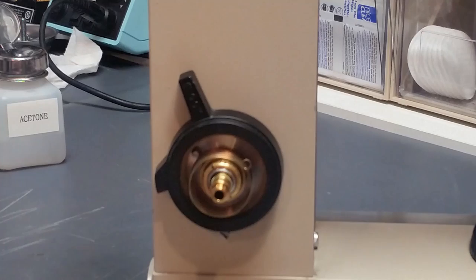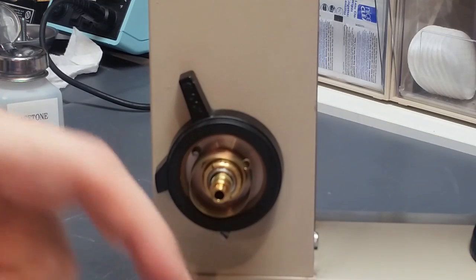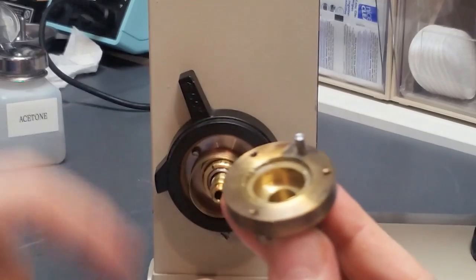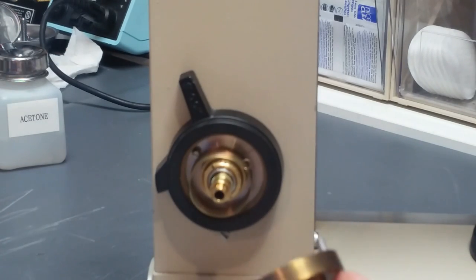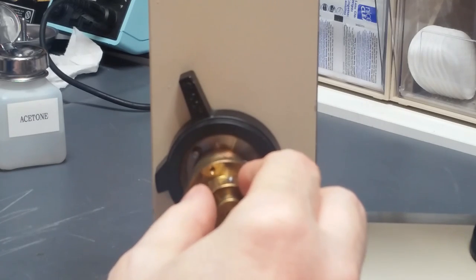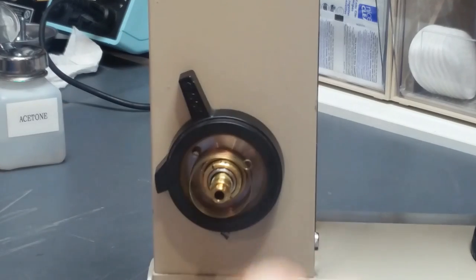Now the next step is this guy here. It goes on there and threads in here, mates with these threads here, and it tightens down. However, before it goes on, this pin has to go into that spring to start with, so we'll do that first.